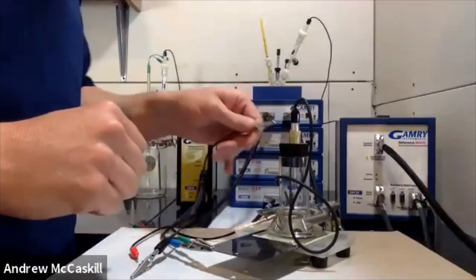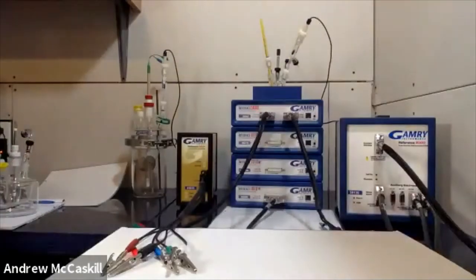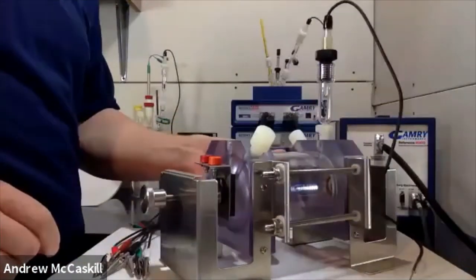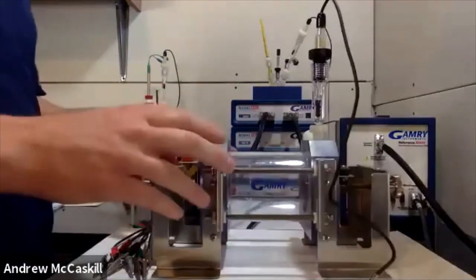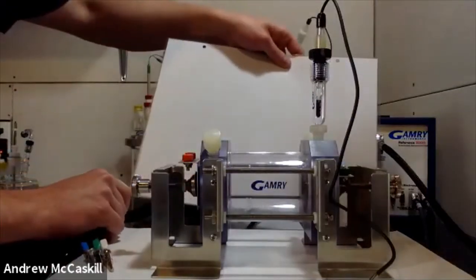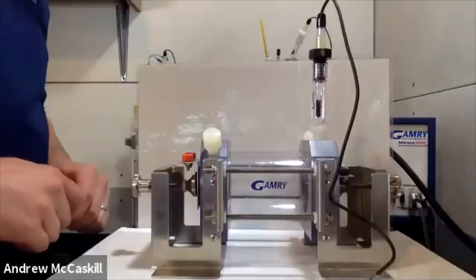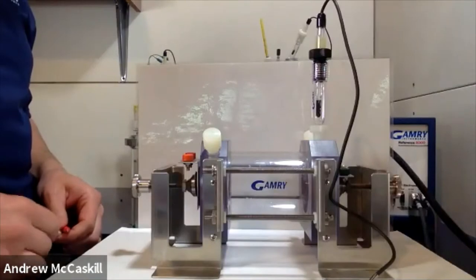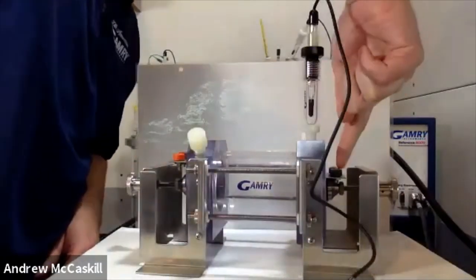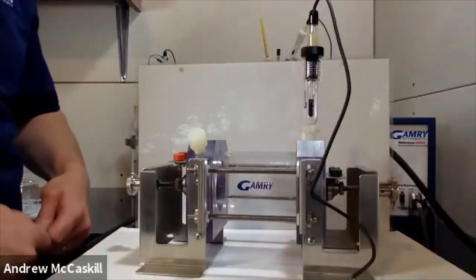Another option for that last question would also be this Paracell. As I go with each cell they're going to get more complicated visually, but at the end of the day it's still just a three-electrode setup — and in this case we can also do a four-electrode setup. This also supports the Paracell kit for flat specimens, and the two specimens are mounted on either side.